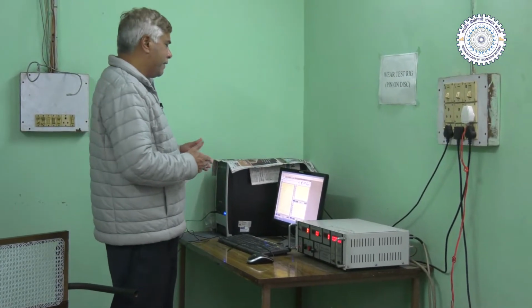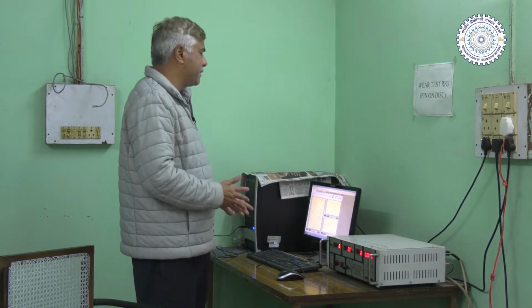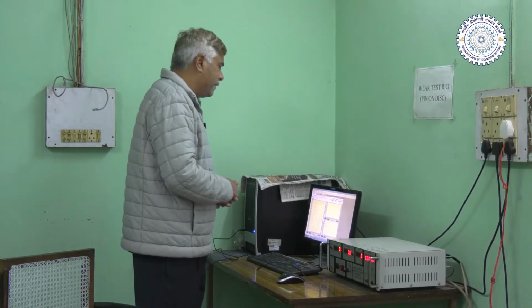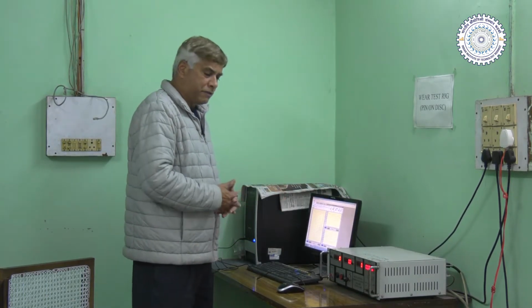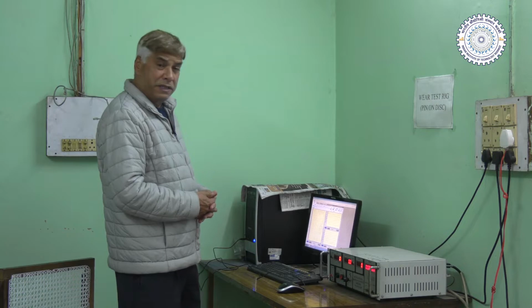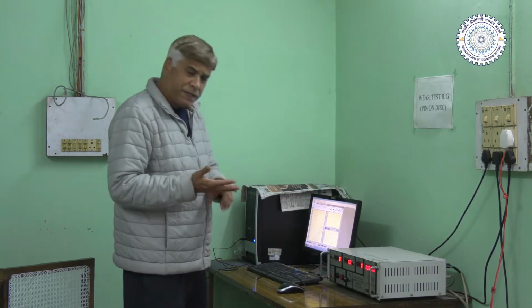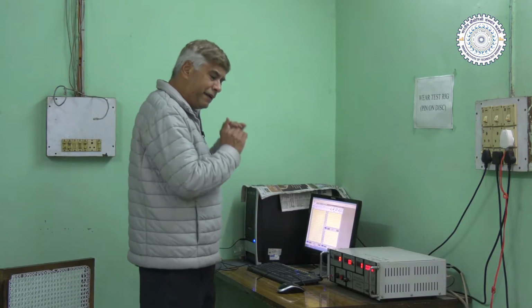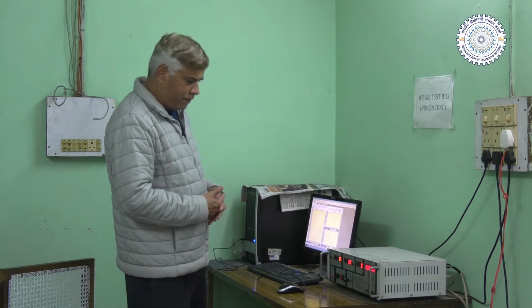It also measures and shows the variation in friction force as a function of the displacement or as a function of time. Then there is also a window for showing the temperature as a function of time during the test. So the friction, temperature, and the wear loss which is happening can all be acquired and seen on a real time basis.